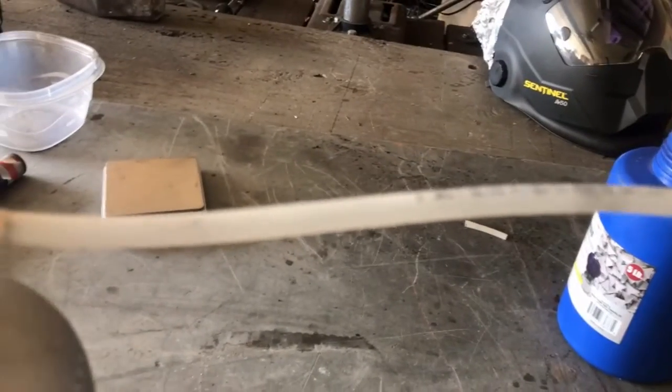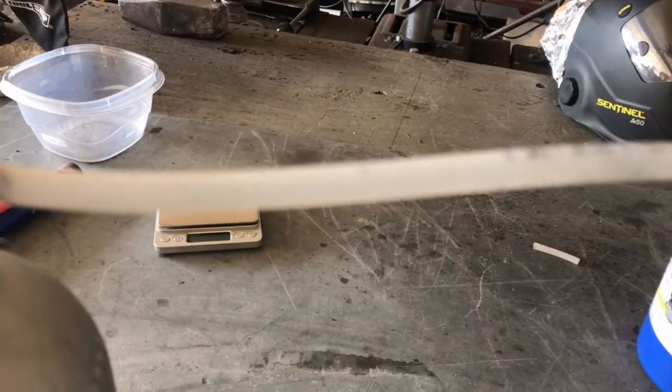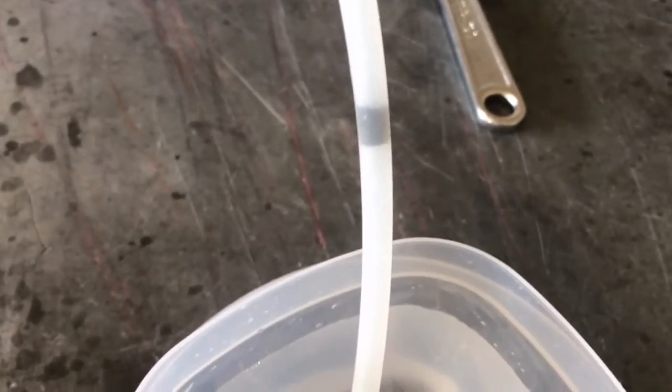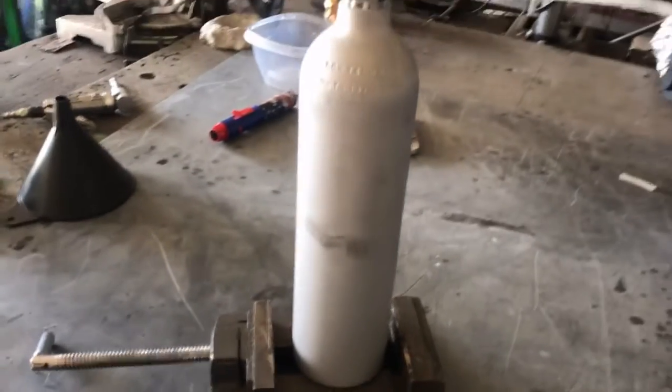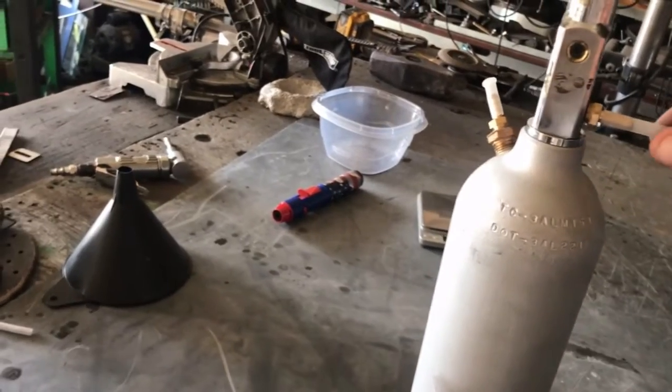It's being liberated in there — see that? So there is some moisture content in that stuff from the torch itself. We are seeing a little bit of steam here; there was some moisture that was absorbed. We are starting to melt the hose here. Everything is getting really hot.